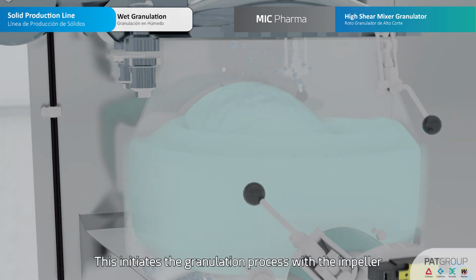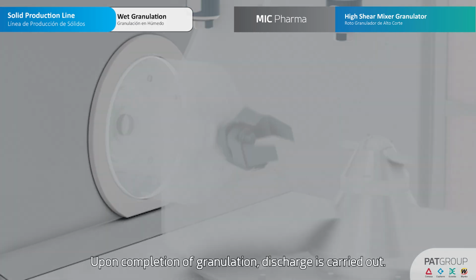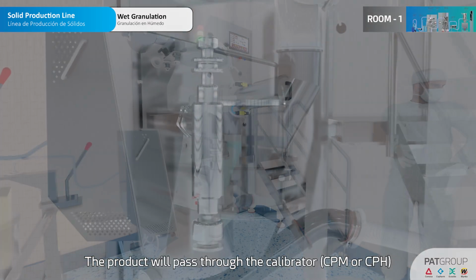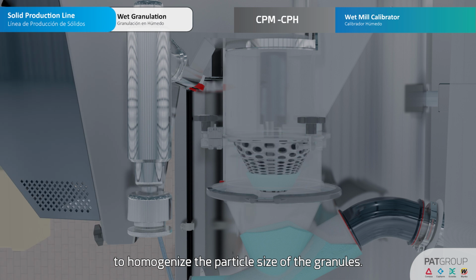This initiates the granulation process with the impeller and chopper, which prevents the formation of large lumps. Upon completion of granulation, discharge is carried out. The product will pass through the calibrator, CPM or CPH, to homogenize the particle size of the granules.